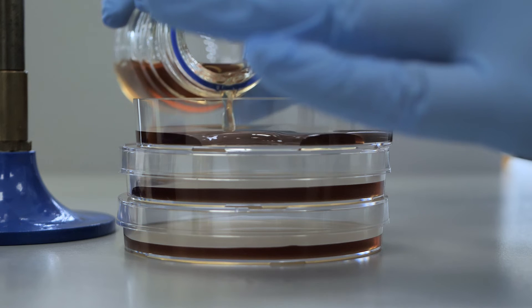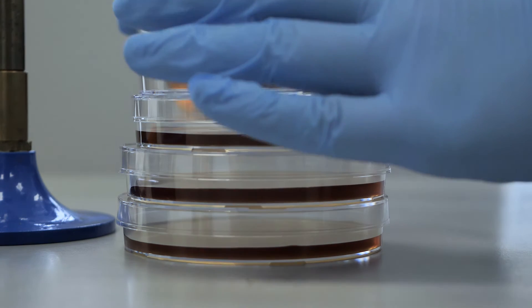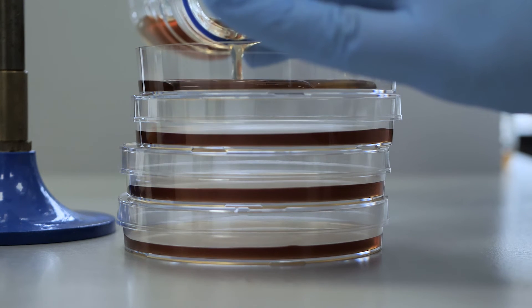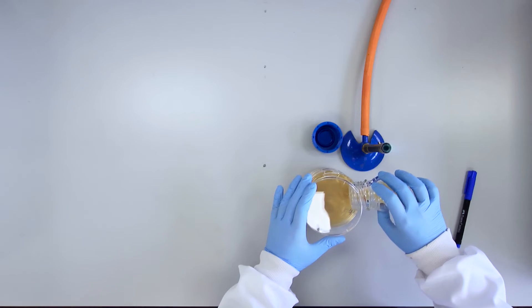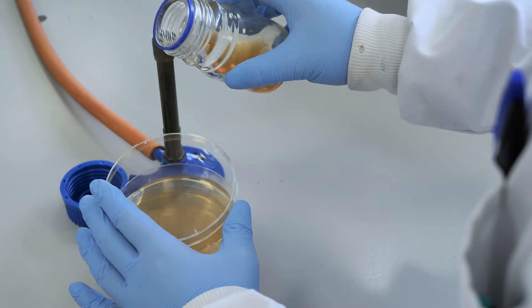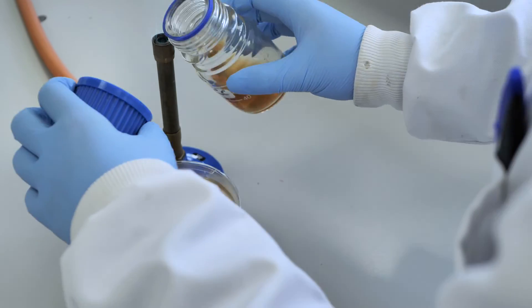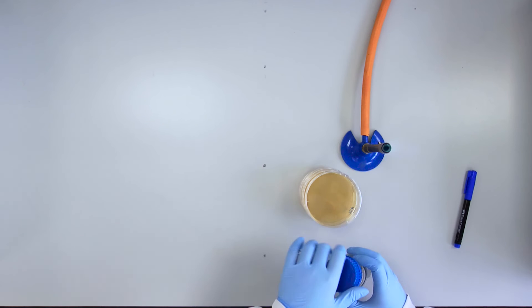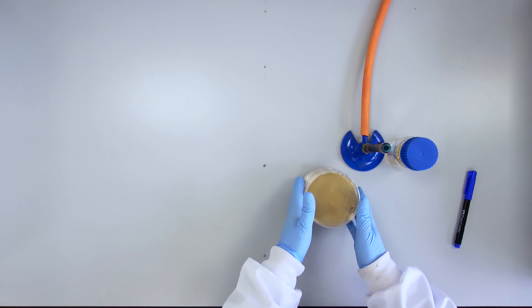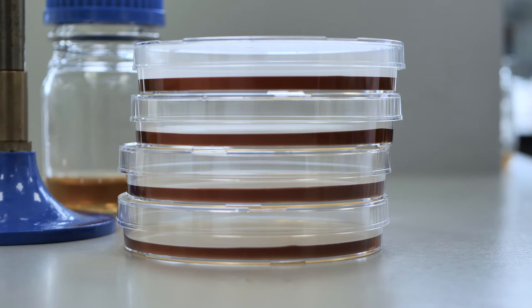This is repeated until all plates have been filled. The agar must now be allowed to solidify, which typically takes 30 minutes or longer. You will notice the agar turns opaque as it cools and solidifies.